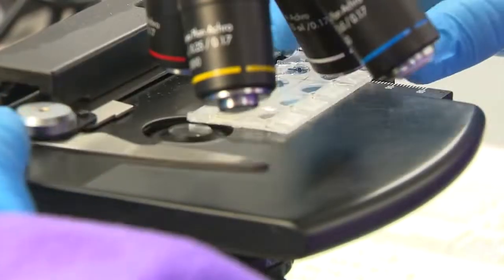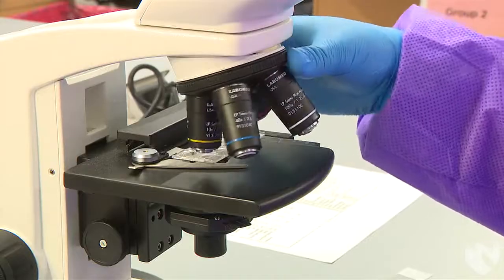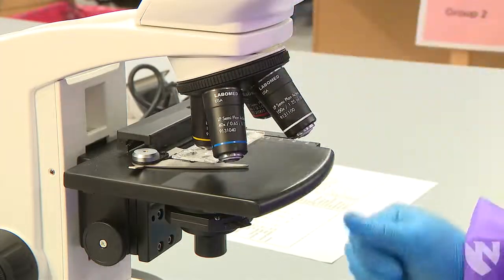Place the Kova slide or wet prep glass slide onto the stage of the microscope. Begin by focusing the specimen on the low power 10x objective.